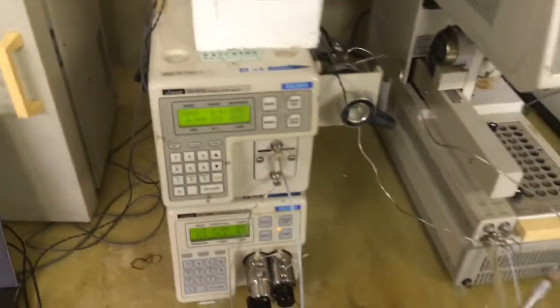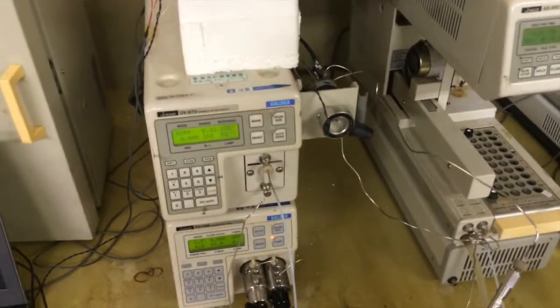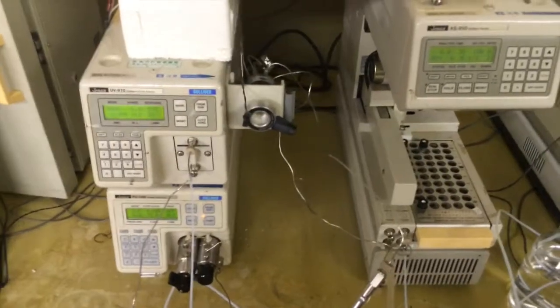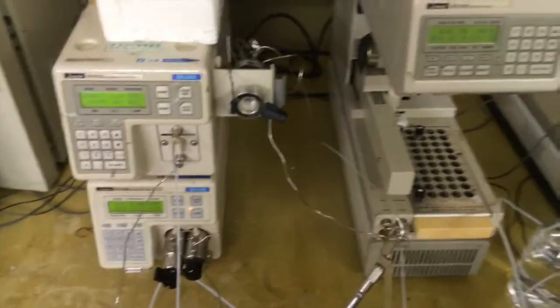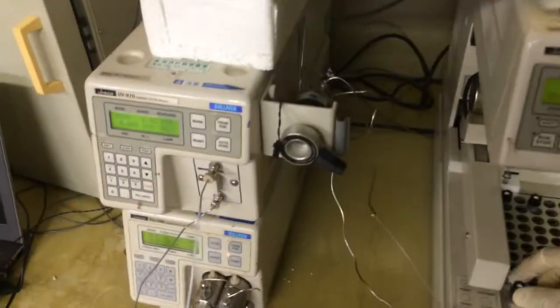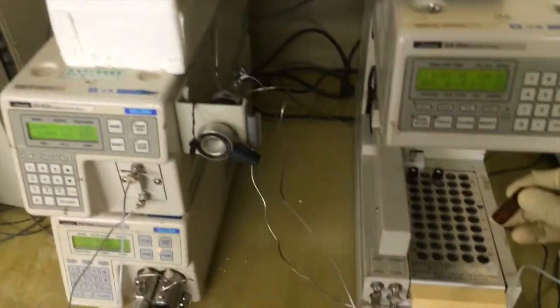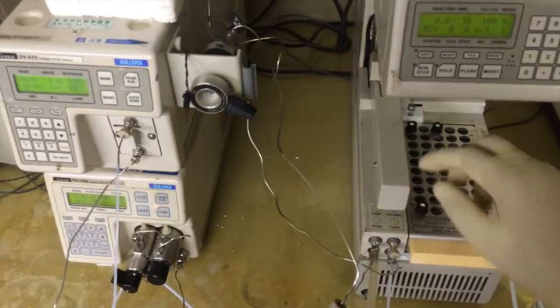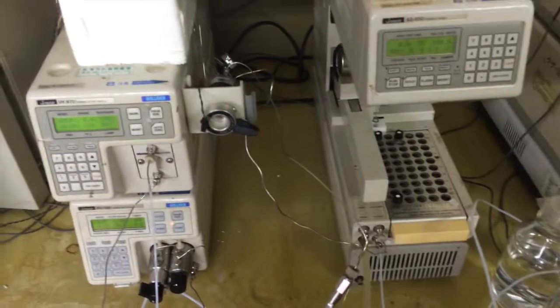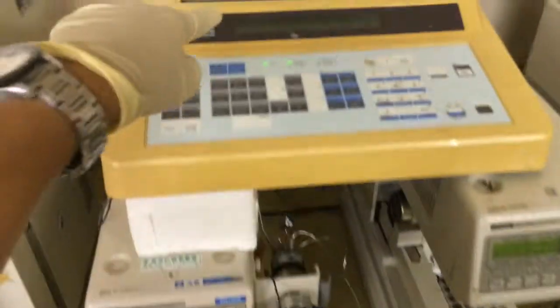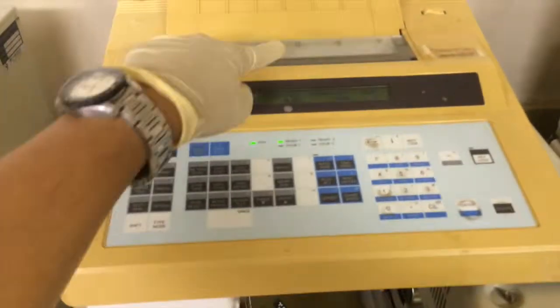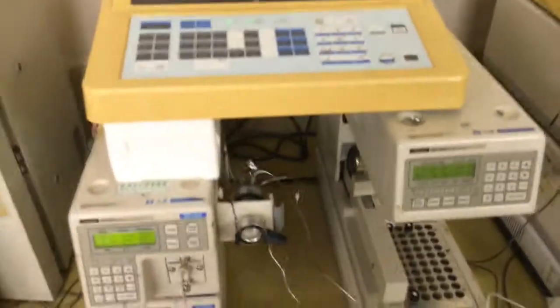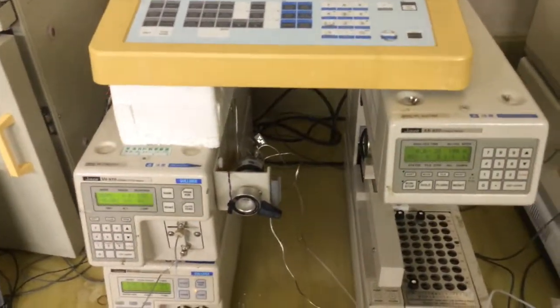Wait for about 15 minutes, then after that, put the solvent to check until we get the baseline. The next process after stabilization is to get the baseline.